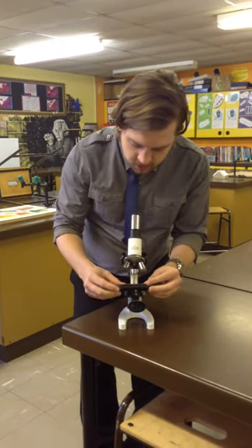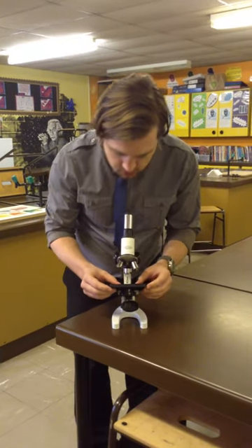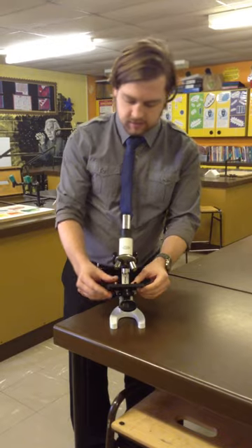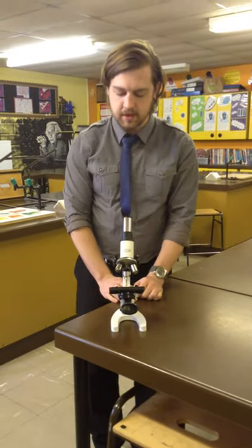You're going to put your microscope slide on the stage so it's over the holes. If you notice I moved the pins out of the way, just lift them back up so it holds the slide in place.